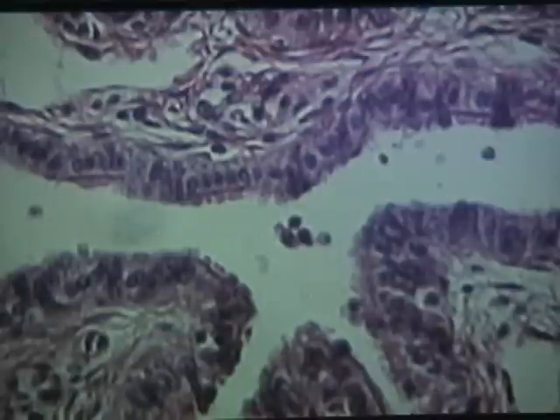This is a high magnification view of simple ciliated columnar epithelial tissue in the fallopian tube. This is part of the lumen of the fallopian tube. This is the epithelial tissue that we're looking at. This is the free surface, and you can make cilia out right here. This is the bound surface. In fact, at this magnification, you can even tell that these cells, such as this one, are longer than they are wide. They are columnar in shape. You can pick out the nuclei of the cells.